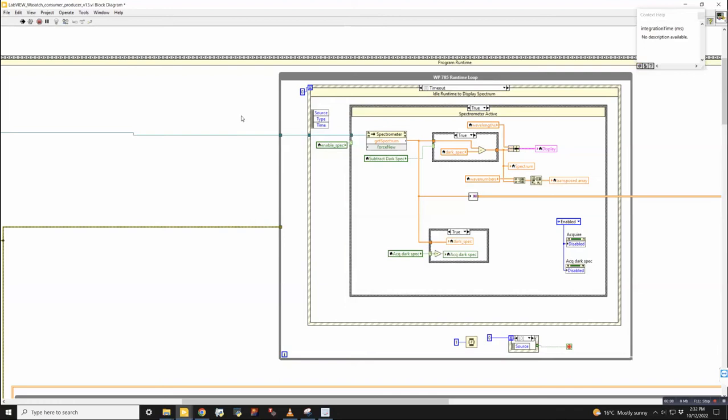Yeah. So my idea was that instead of having a driver to get the data from somewhere and put that in another loop that we have, we can just have a local variable like transpose data and then get it from here to the others. But we realized that it is a better way to have a driver to write and read the driver, to get data into other loops that we have. So it's just for checking. The way I realized from Luke that it's the best way to write in LabVIEW is to check everything that is running. So even though some of the variables are not worthwhile anymore, they will help us check that everything is running.